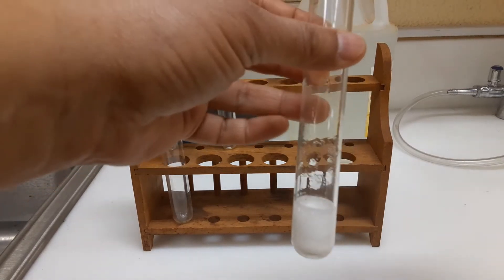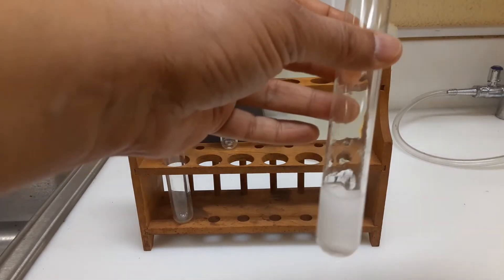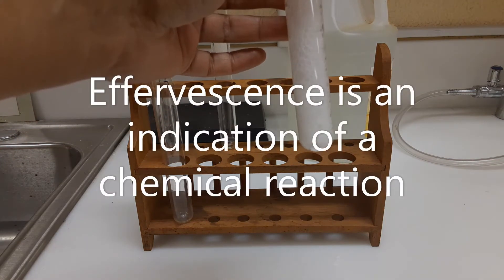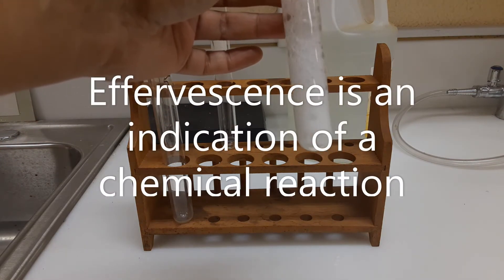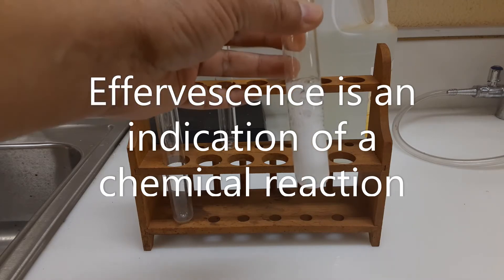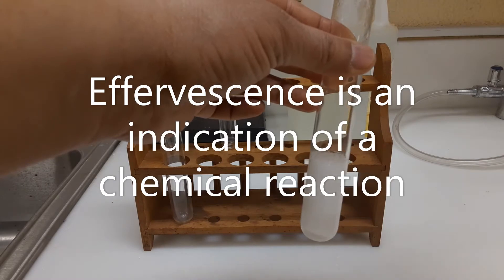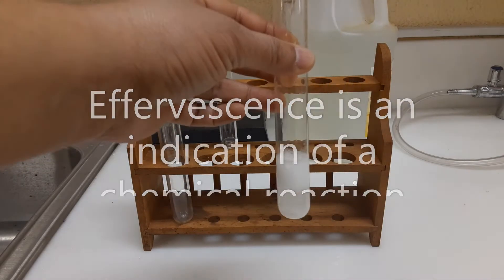This is what we call effervescence. When you see effervescence in a reaction mixture, we know that the chemical reaction is taking place. So effervescence is one of the indications of a chemical reaction.